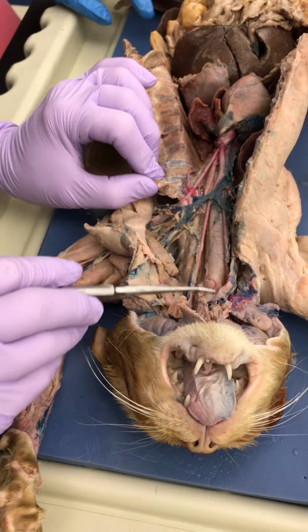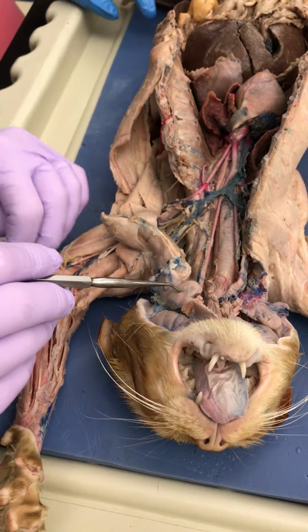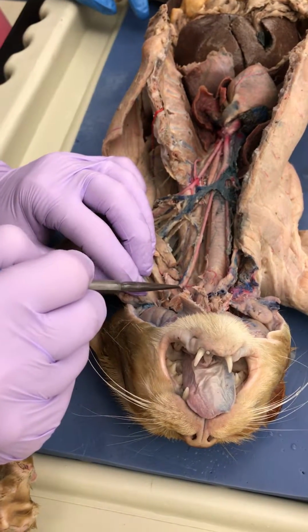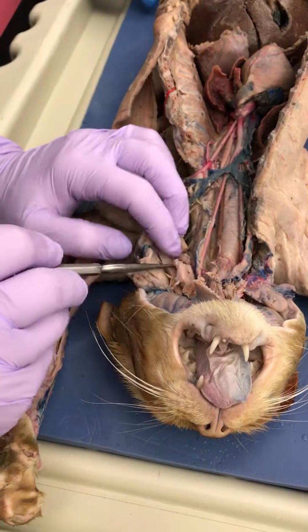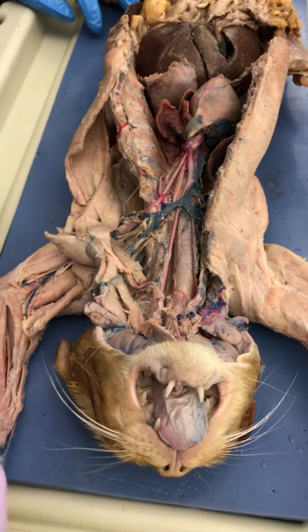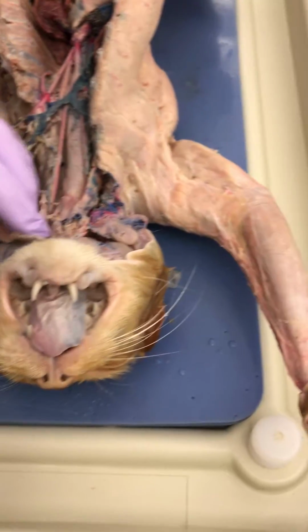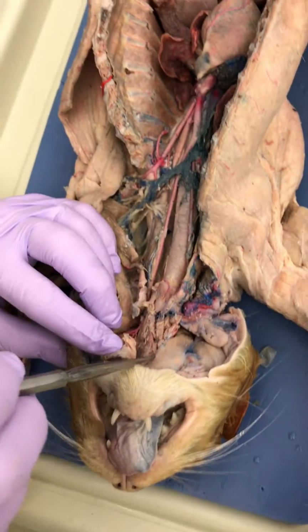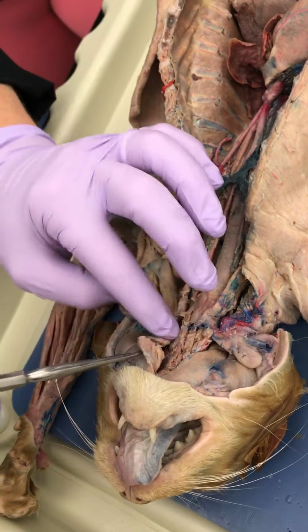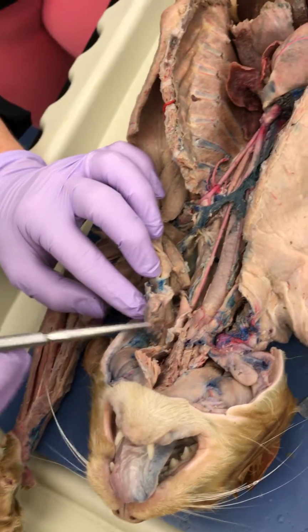Okay, so trachea, larynx. We already mentioned the parotid gland. And what did you guys do with your submandibular? Here it is. Submandibular gland. Now, I was telling you in lecture the other day, to find sublingual, we'd have to take all this musculature out. So I don't want to do that. So we did find the submandibular and the parotid, and those are two salivary glands.